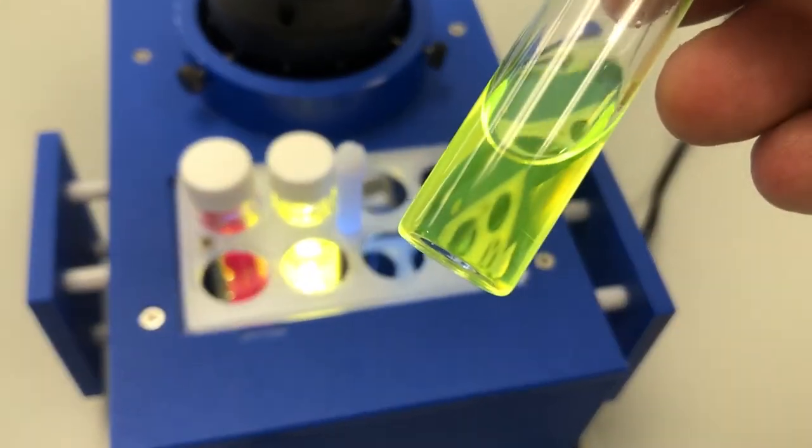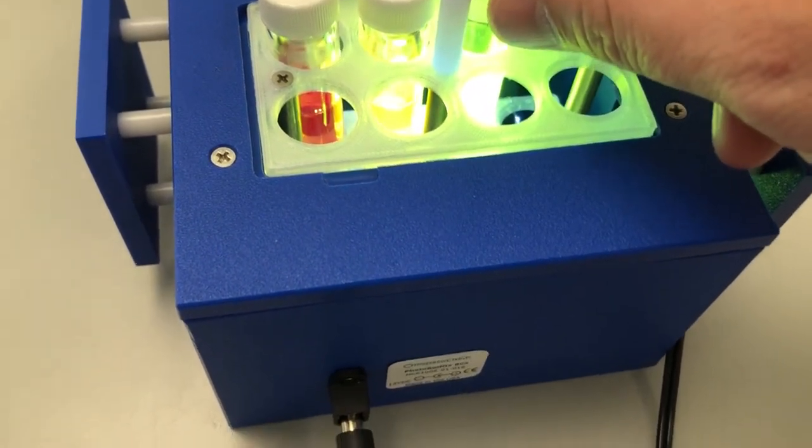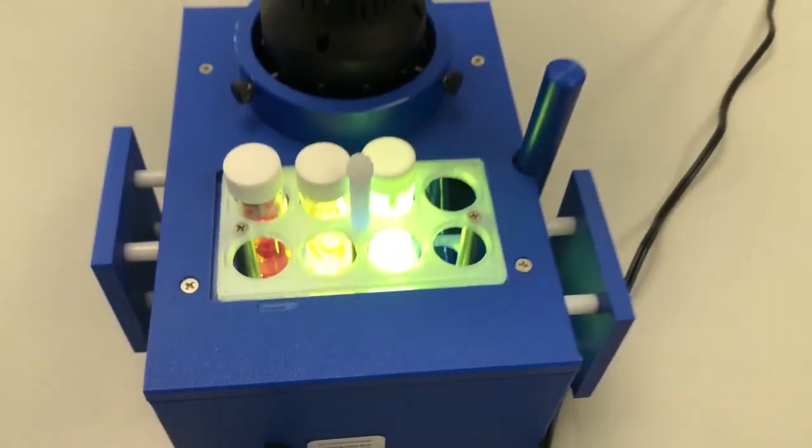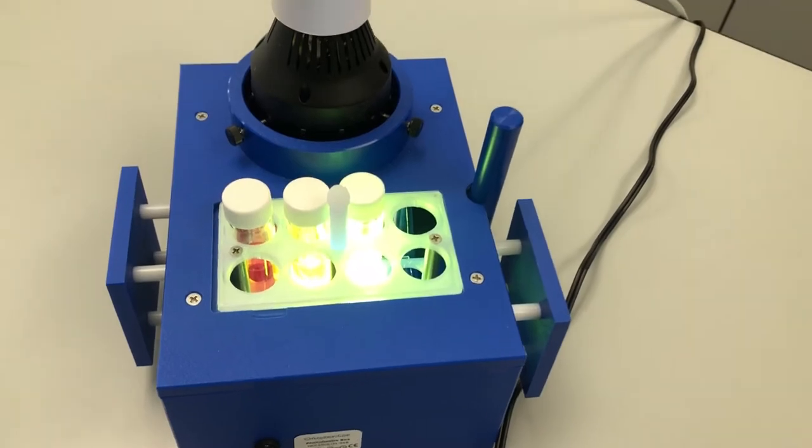Finally, we placed the green in the vial, and whoa, that is bright. Sort of like those neon glow sticks you played with as a kid or at your last music festival.